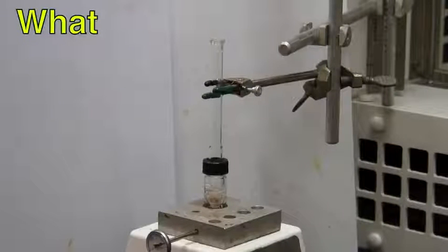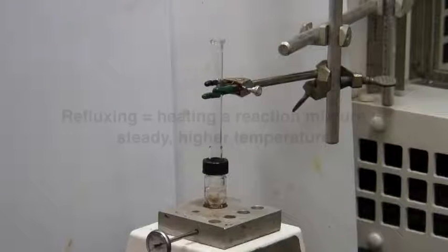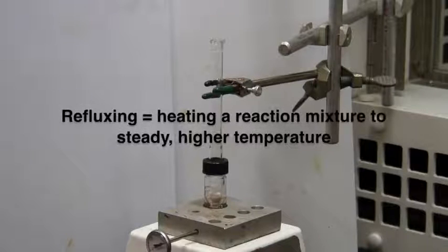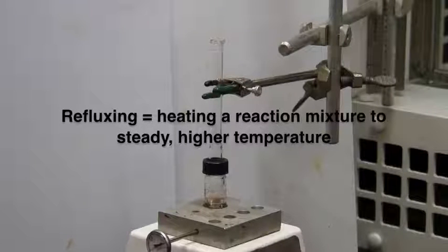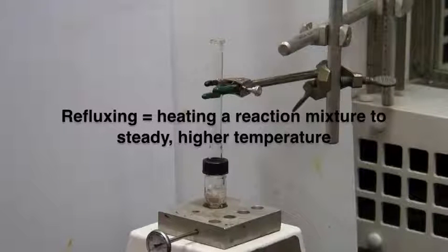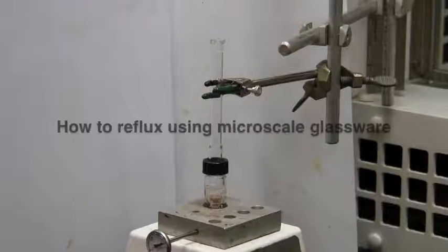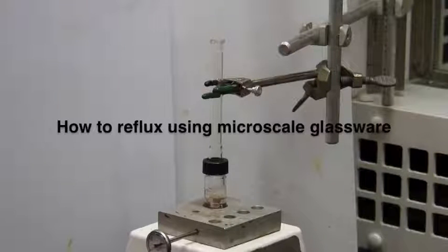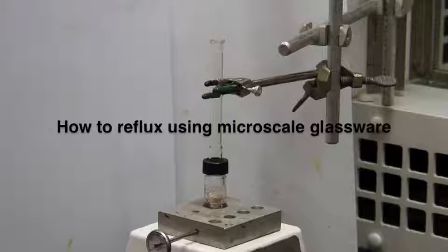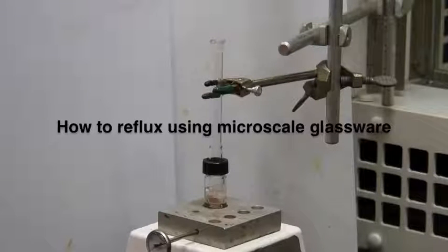One of the standard techniques in synthetic chemistry is refluxing, which is performing a reaction at a steady temperature above room temperature. This video talks about refluxing and how to do it using microscale glassware.